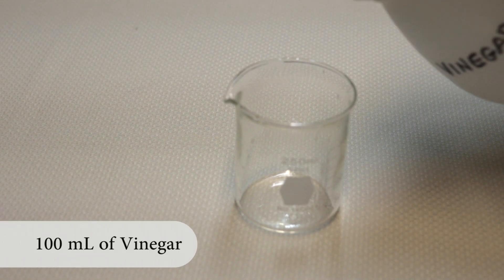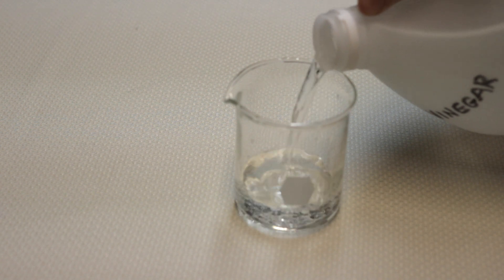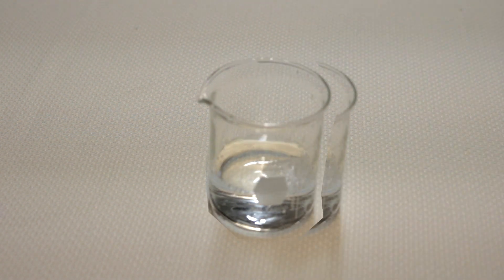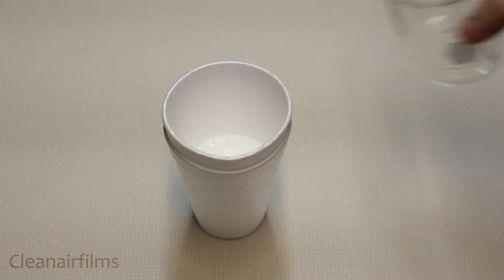Now measure out 100 milliliters of vinegar in a beaker. Pour the vinegar into two stacked Styrofoam cups. This will be our calorimeter.